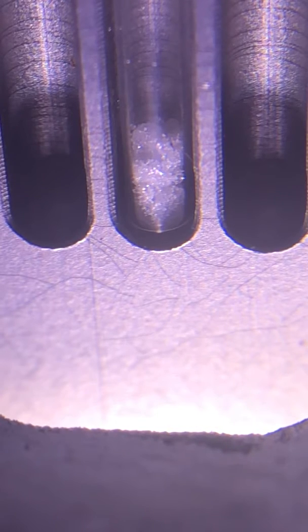It should take two or three minutes at this rate to get to see everything that we need to see. We're at 117.3. With pure samples the melting point range is usually one or two degrees around the melting point.